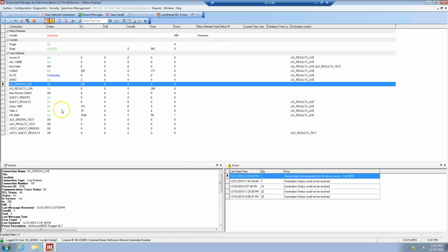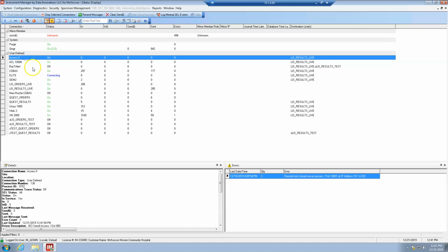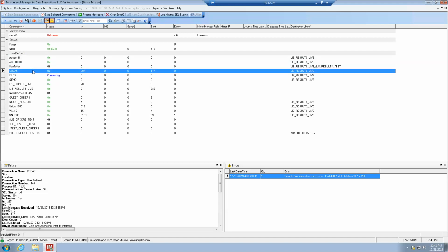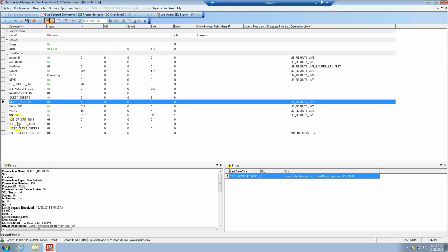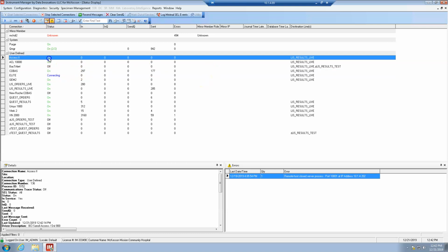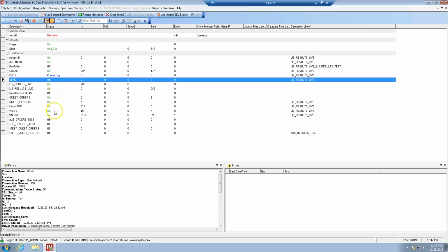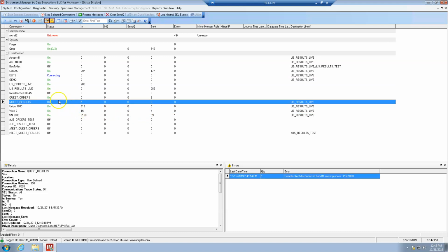Okay, and then once the orders come here, they distribute to the individual machines. So these correspond to actual machines upstairs in the lab. This is from Quest, so that's not actually a machine. XN is a machine. COBAS splits to two other machines, so these correspond to actual machines upstairs. So if they specify one specific machine is not working, you can pinpoint it here. If it says connecting or it says off, ask them which one it is, and then you can give that a start, and that way the orders will process.